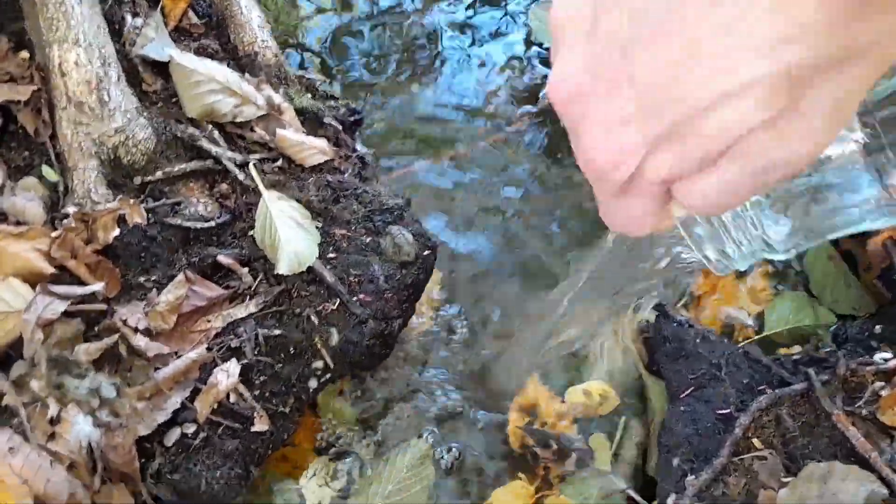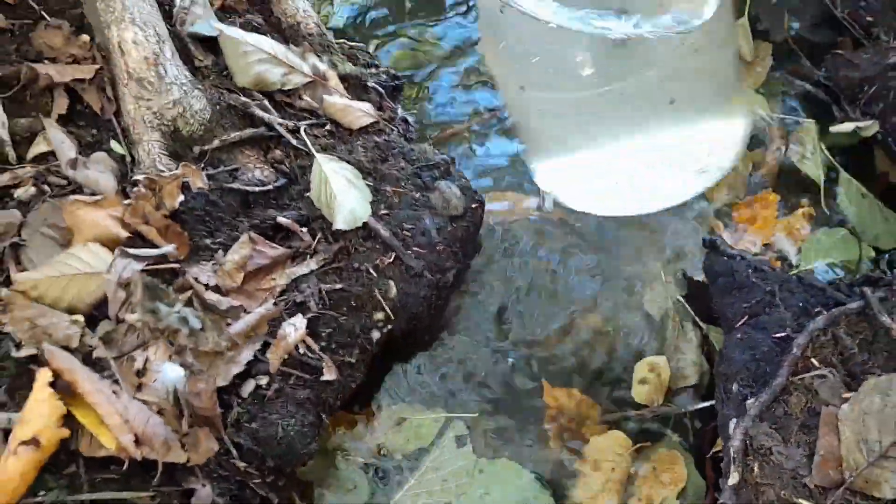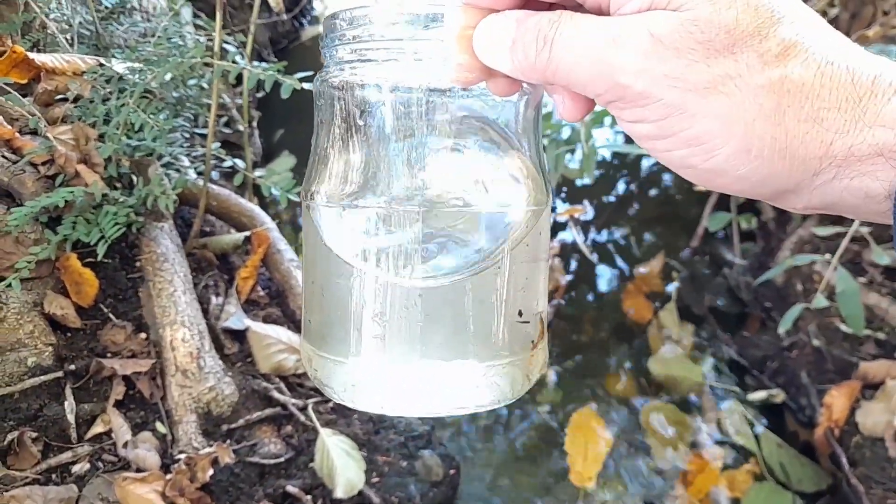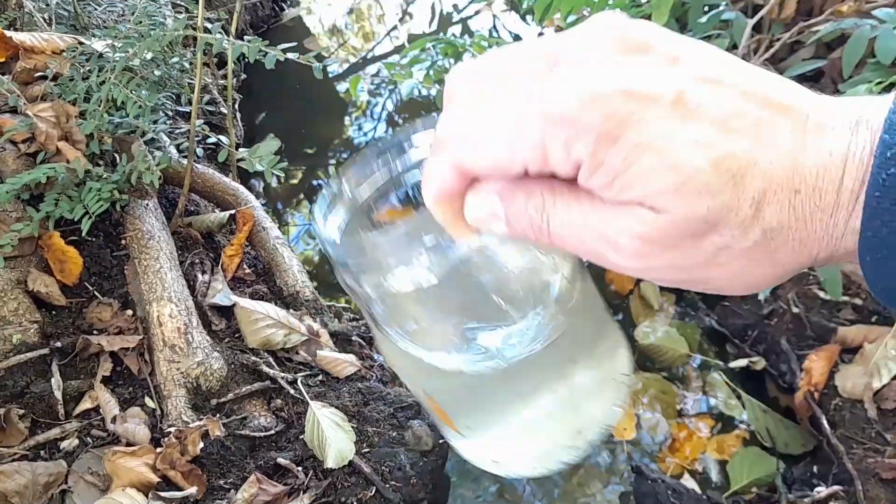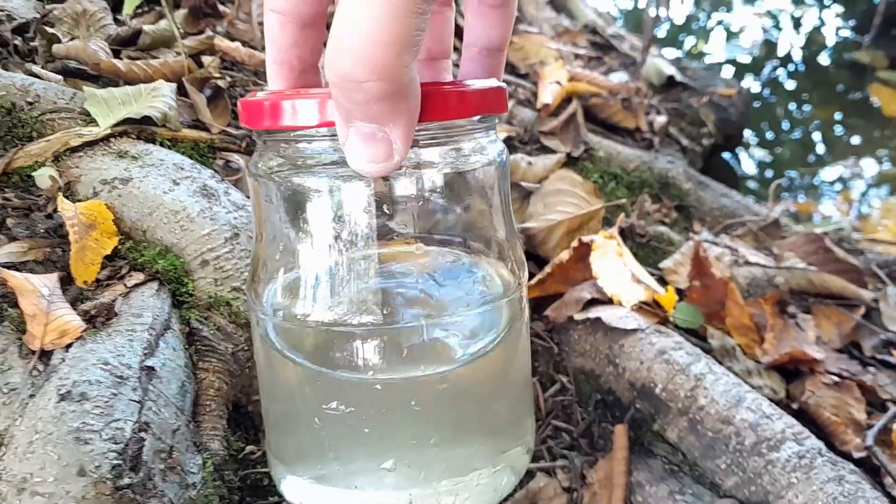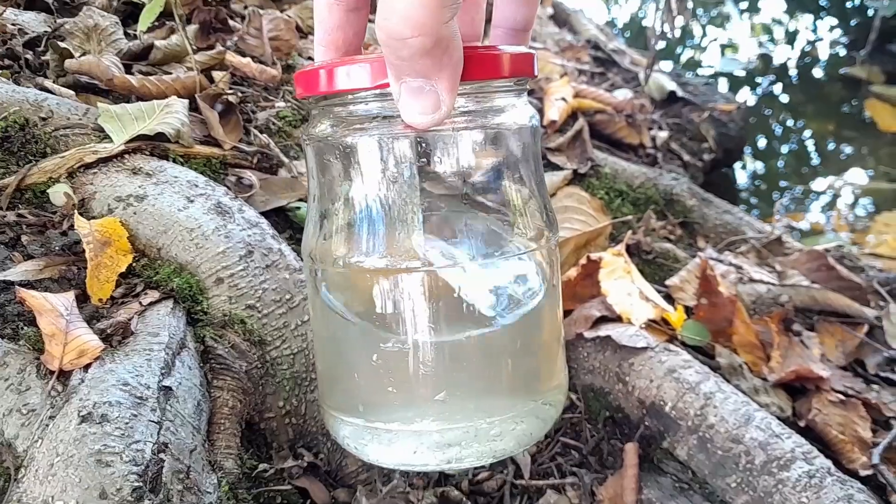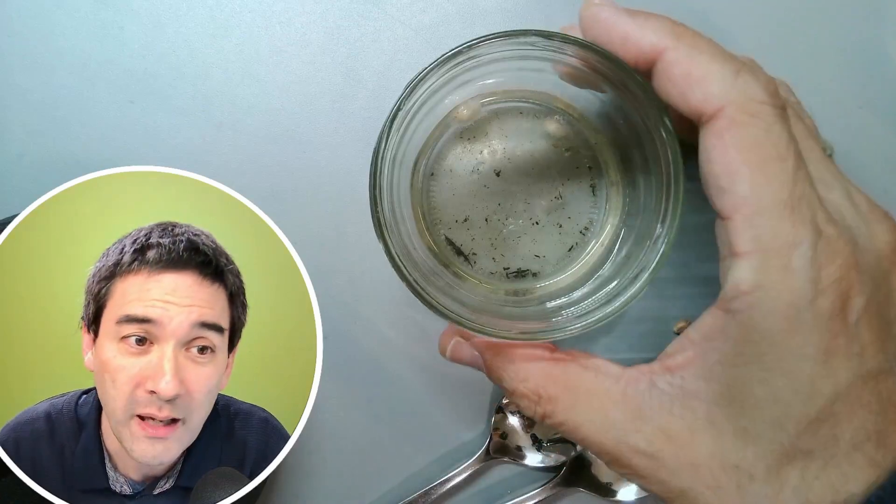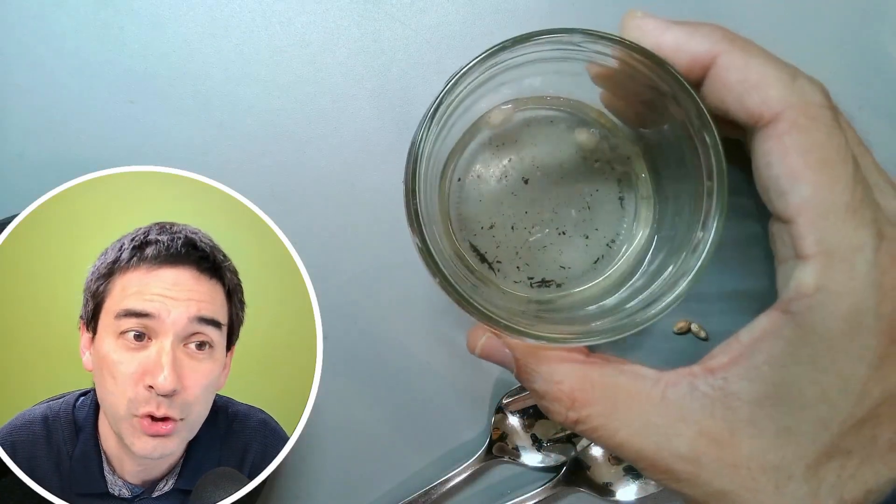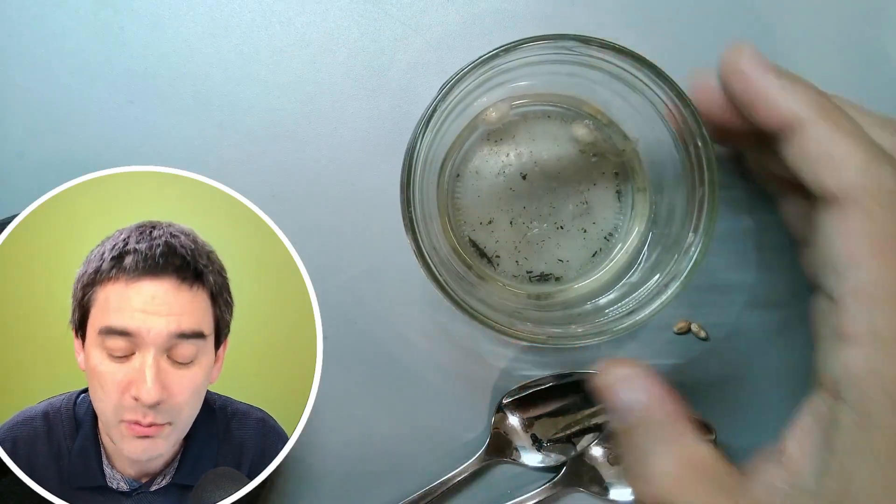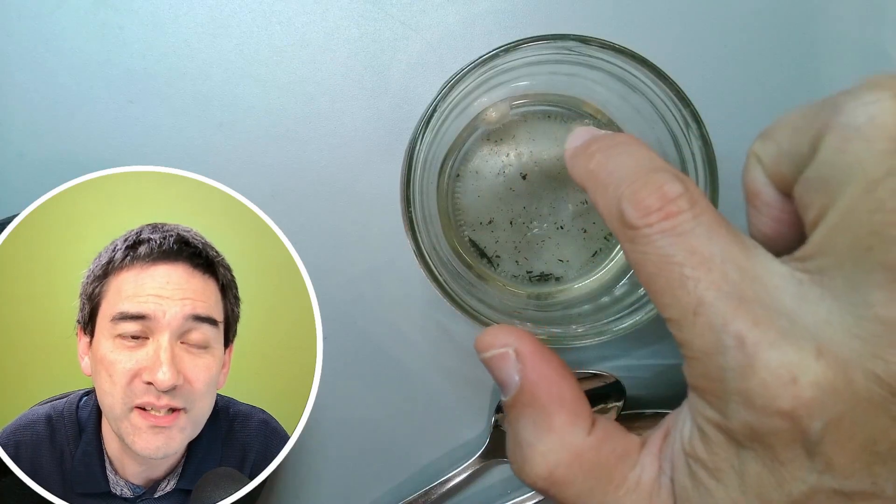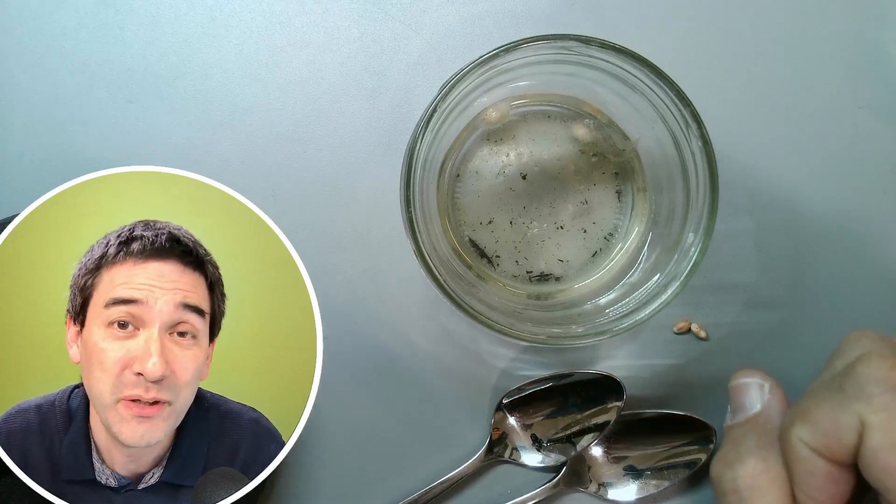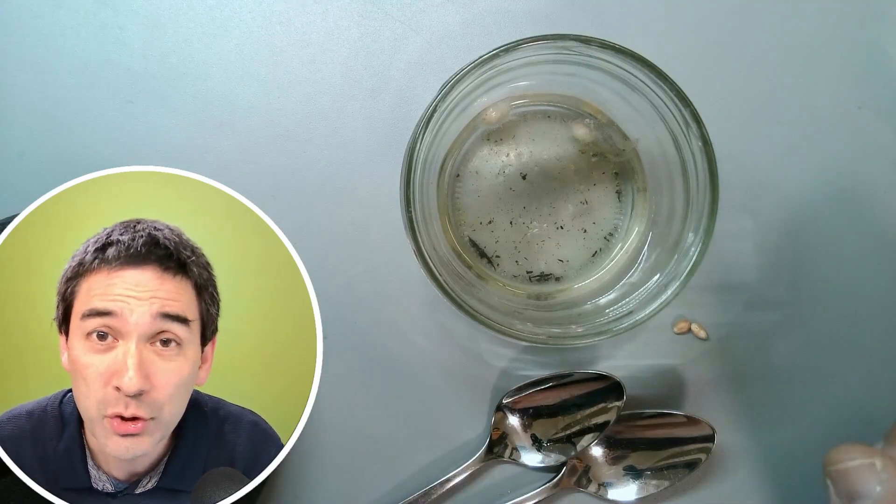The water sample that I collected from the pond, I collected not only the water but also some sediment from the bottom. I took a little bit of water out and poured it back in to agitate the ground. Then when I collected the pond water, I took it home and put a small sample into a separate jar. You can see this slimy stuff here on the side—that is some of the food I added to enrich the microorganisms. I want to show you what I have done.